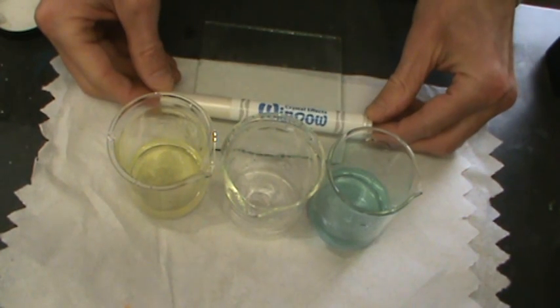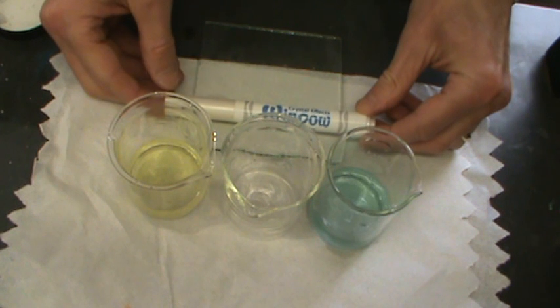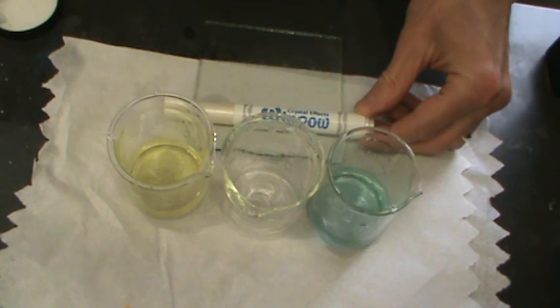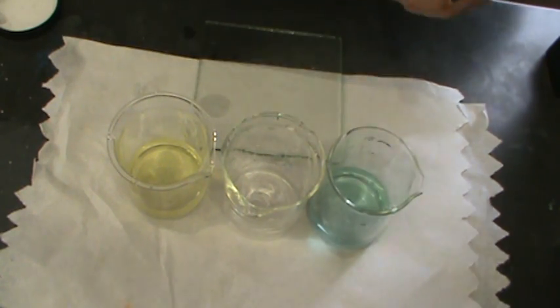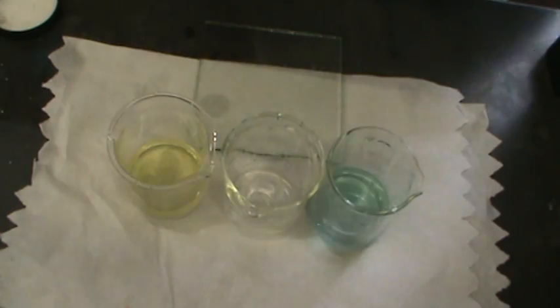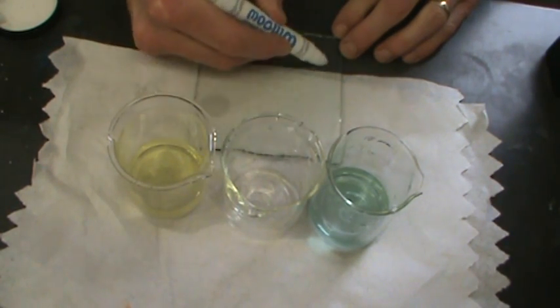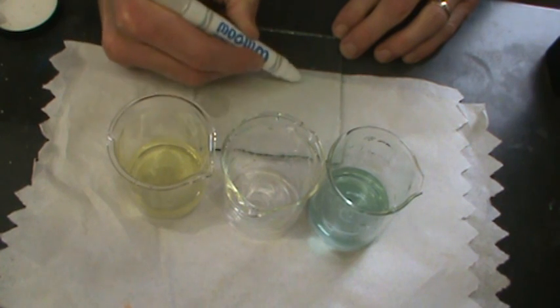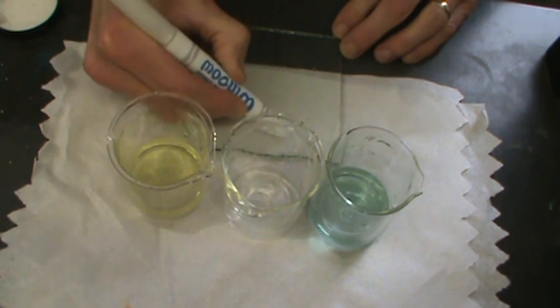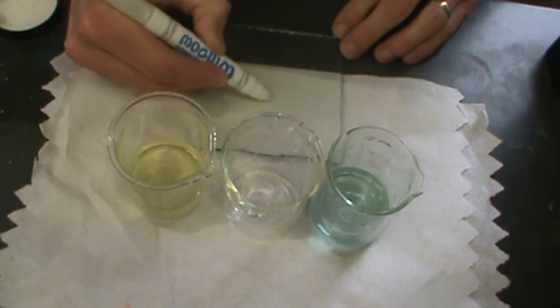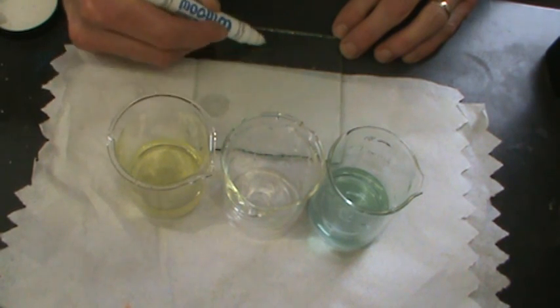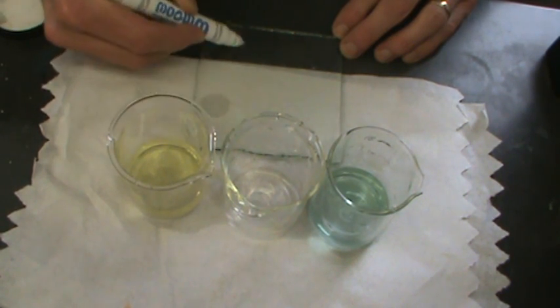Now, if this contains sodium acetate, then this should show a similar effect with the bromothymol blue indicator. So what I'm going to do to collect some of this residue is I'm just going to go ahead and draw the marker onto this glass pane. We're going to wait for that to crystallize. We're going to try to get as much residue on the glass pane as possible.